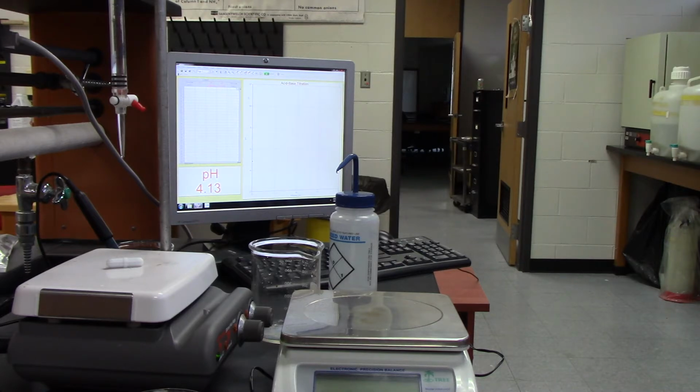And so this technique that we're using is a pretty powerful technique. It's used in labs all over the world to do all kinds of different experiments. They're going to be doing something similar. So it's a titration, like we did with vinegar. We're going to be titrating acid, and from that data, we'll find out its molecular weight and its Ka, or pKa.